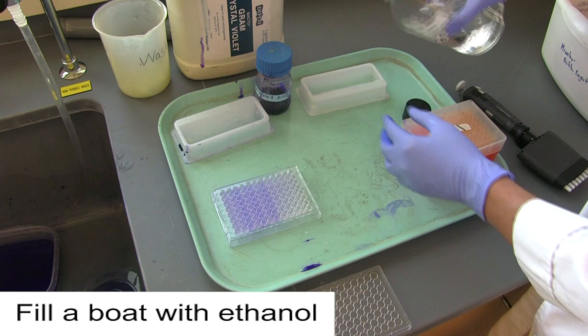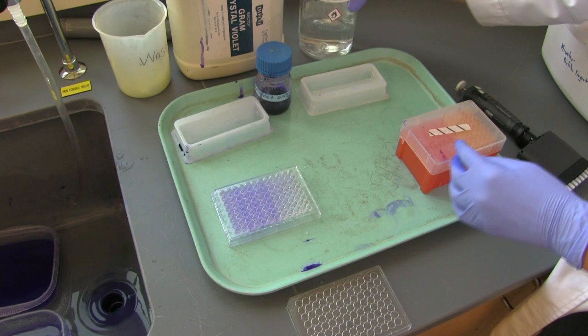Next, fill a second boat with ethanol. This will be used to solubilize the cells.